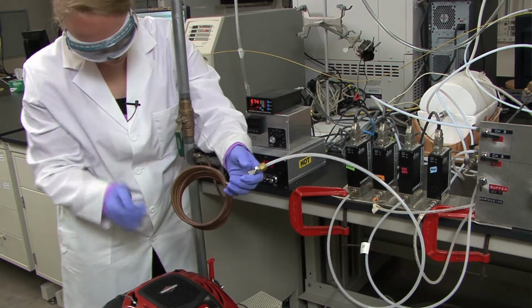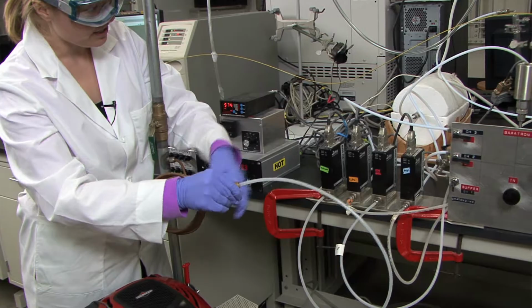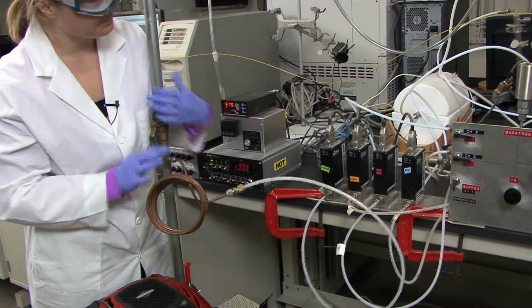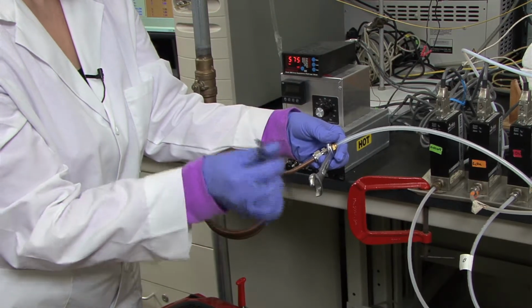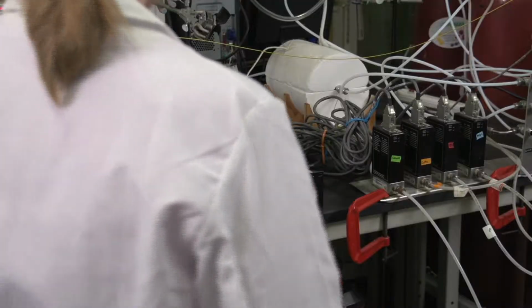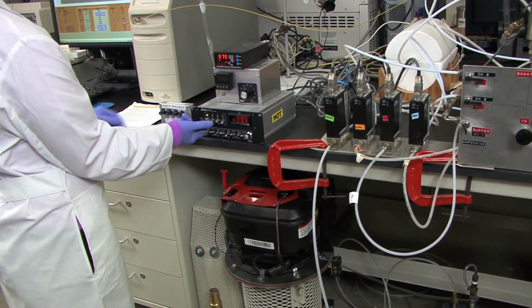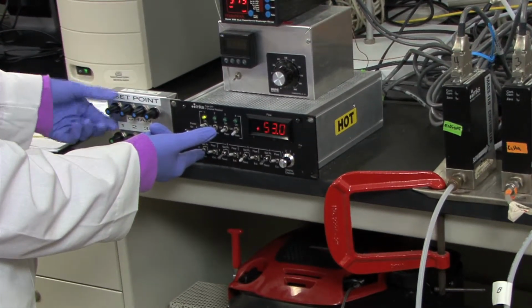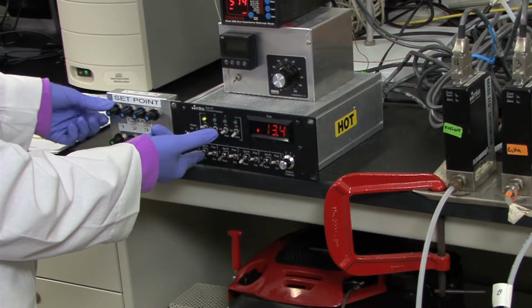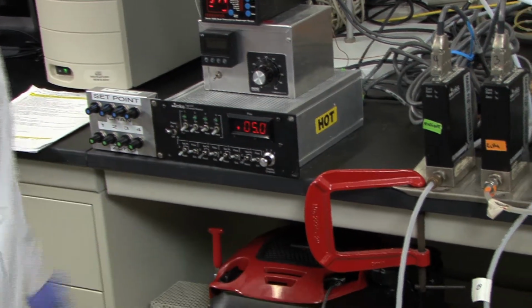So then the exhaust, when this lawnmower is on, the exhaust will come through here and then go into the engine gas readout. Make sure to tighten this with the wrenches to ensure that the line is properly attached. So now that your purges have been completed, you can turn off the argon. So to do that, you're going to want to set the flow rate to 0. And then turn off that screen reading.